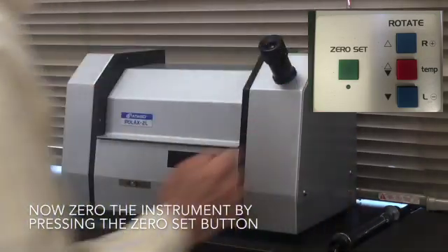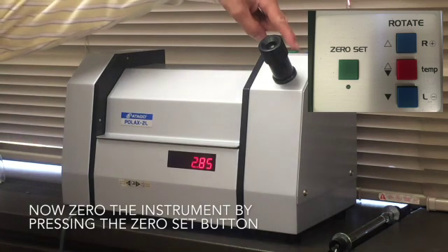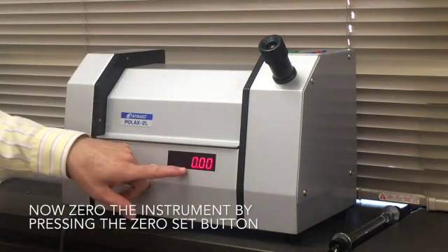I've got it lined up. I now press the zero set button and it reads zero.